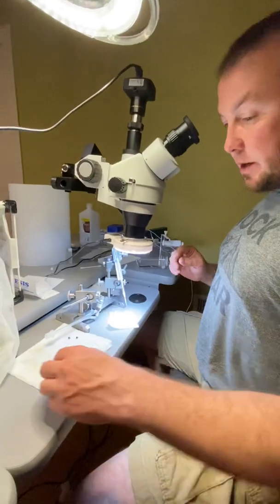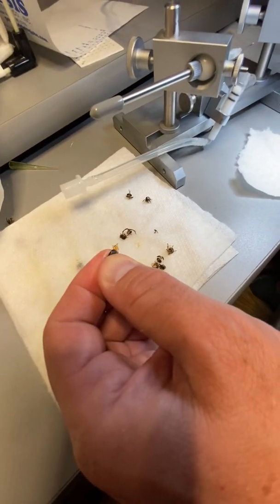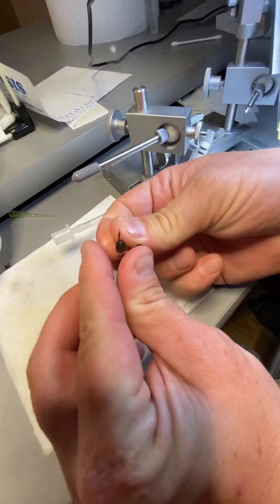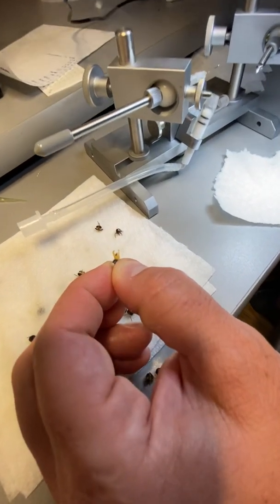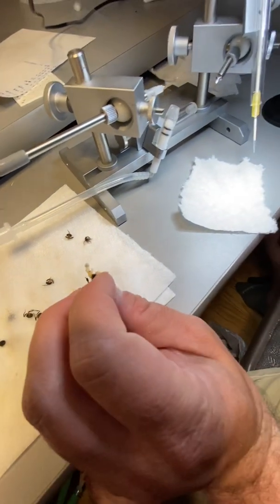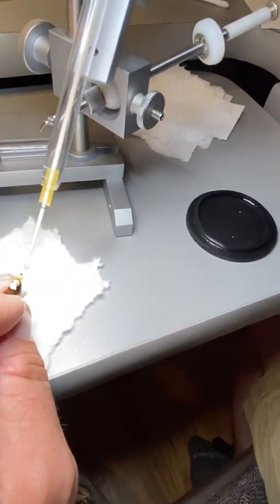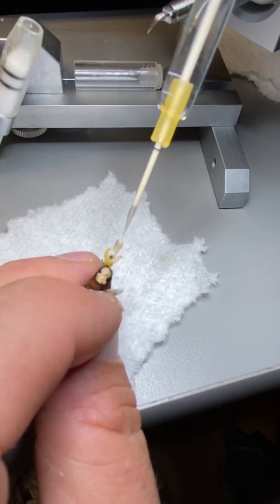If you're going to do a decent-sized batch of queens, like ten or a dozen at a time, you're going to be sitting here for hours and hours. As you can tell, these drones don't have heads any longer. You decapitate them and give their abdomen a squeeze. Some of them are good and some of them aren't.